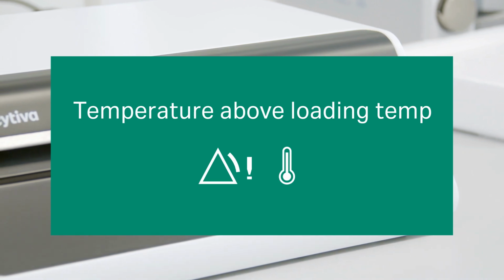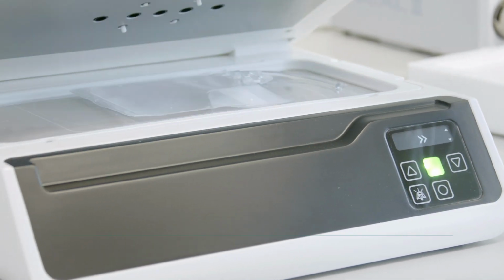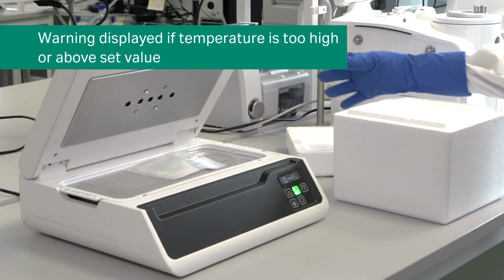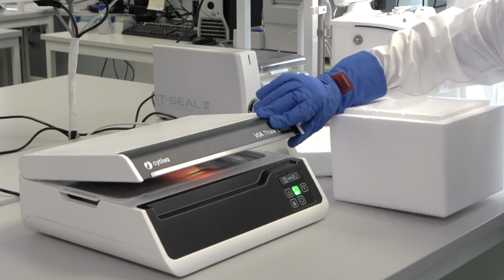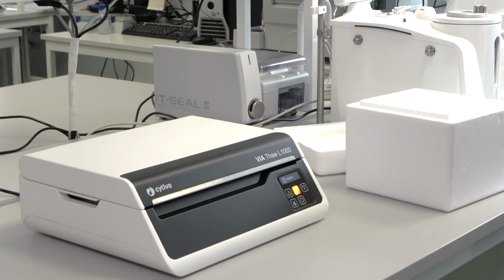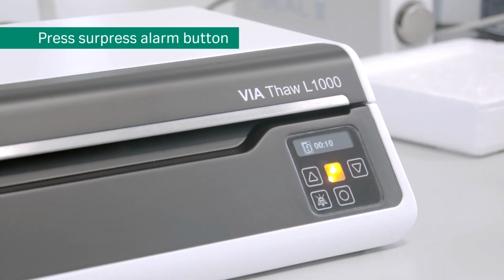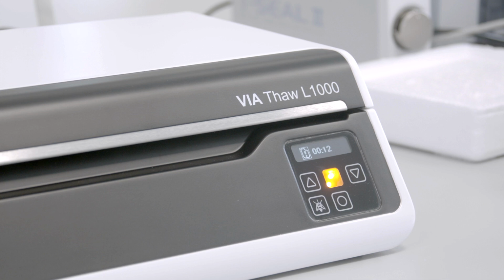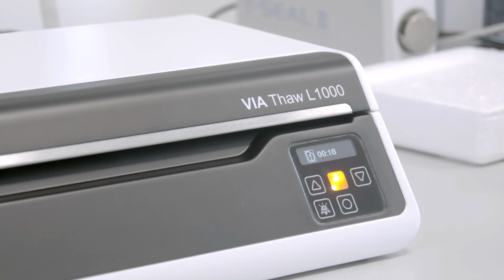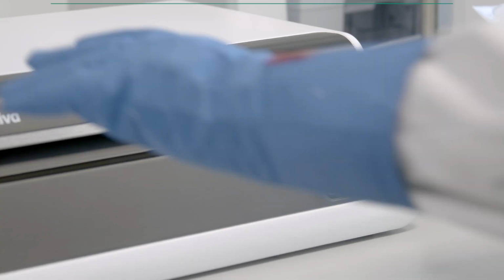The temperature above loading temp warning message is displayed if the cryobag temperature at the beginning of the process is too high or higher than a user-defined value. For example, this warning could be triggered if the cryobag is transferred from long-term storage without insulation. When loading the now warm cryobag, the instrument detects that the bag is too warm and shows the error message. This triggers an alarm, which an operator can acknowledge by pressing the Suppress Alarm button. This error message alerts the operator of a potential issue and is recorded both in the process log and onto Chronicle, but it does not stop the instrument's thawing process.